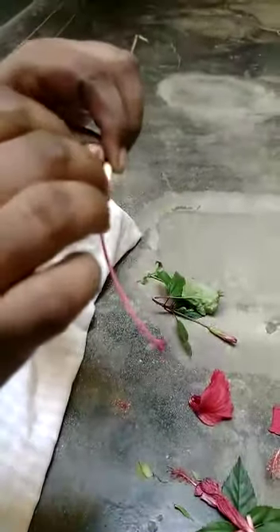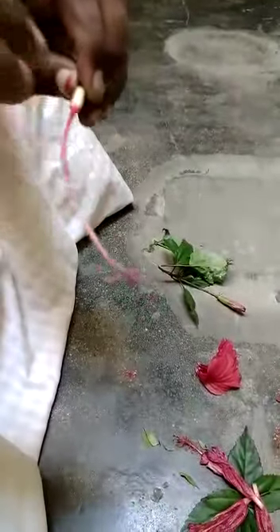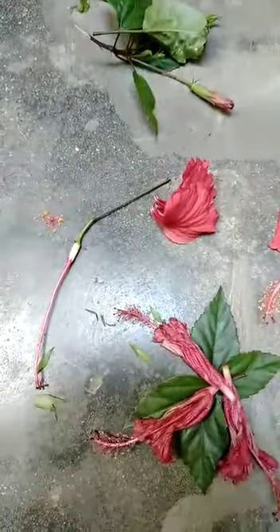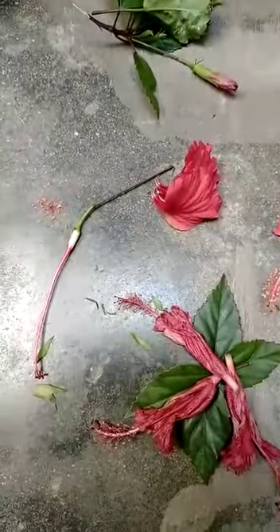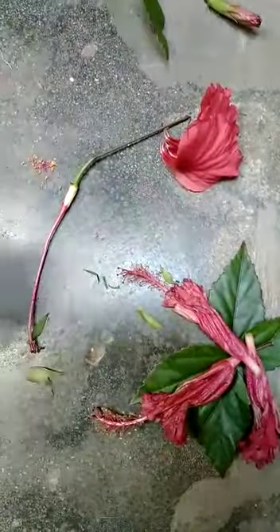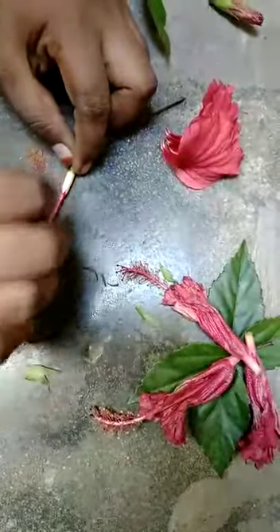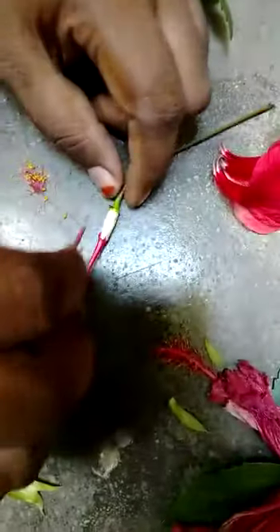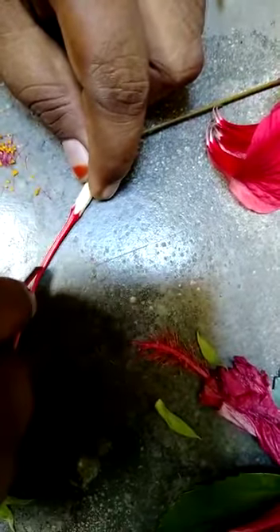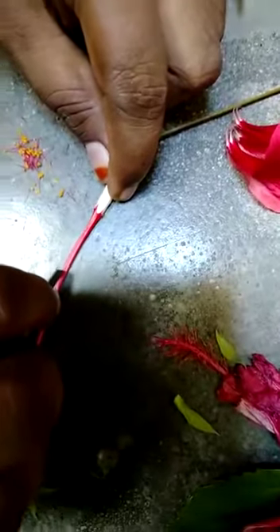This is a very careful step. This is very delicate, so be careful. The tube will be very very thin, so be careful while you cut this. Don't cut fully — please don't pierce it all the way down. Just scratch only the top layer. Start from here, just the top layer alone. Inside this there will be a very fine thin tube.